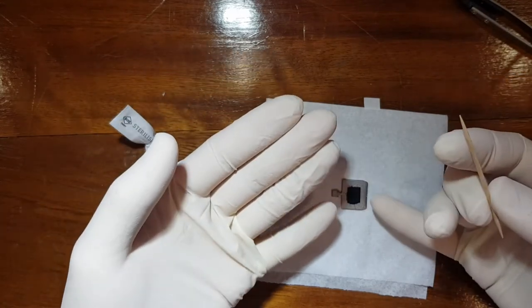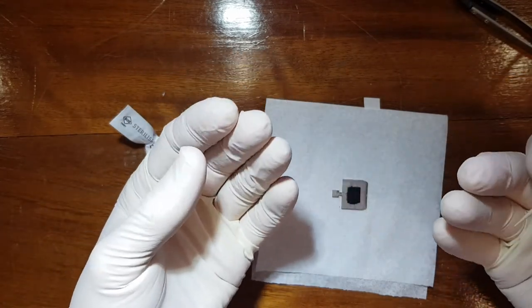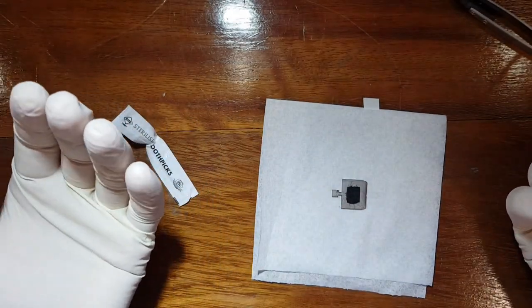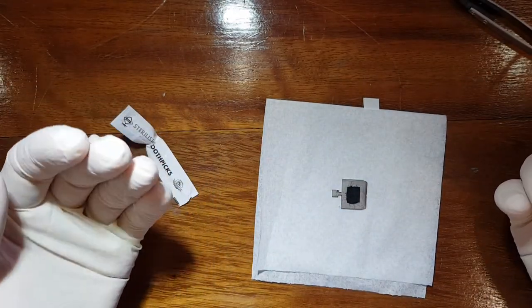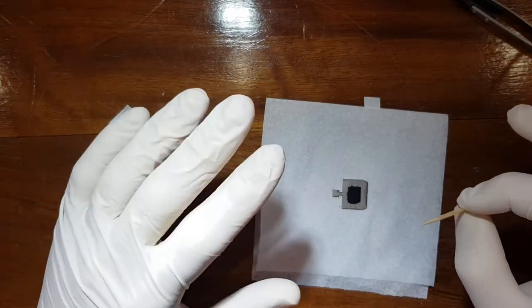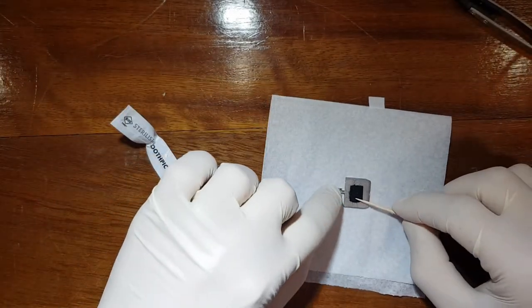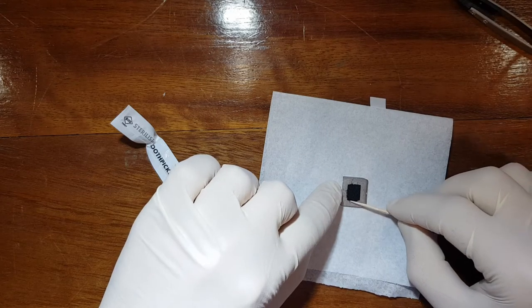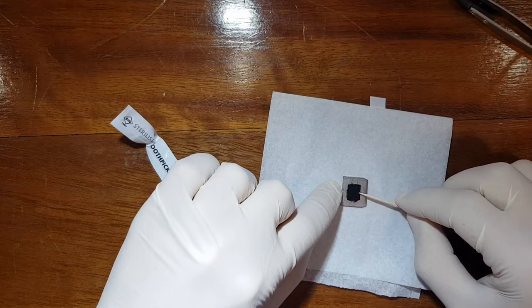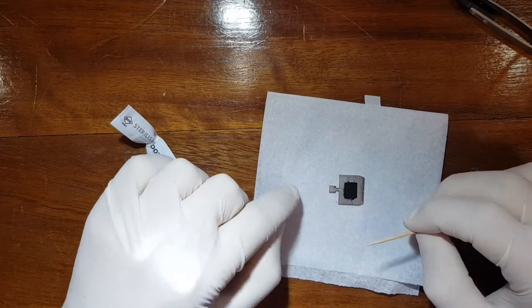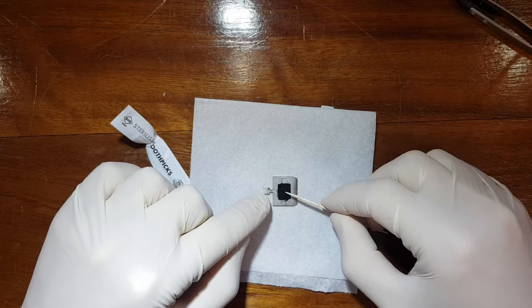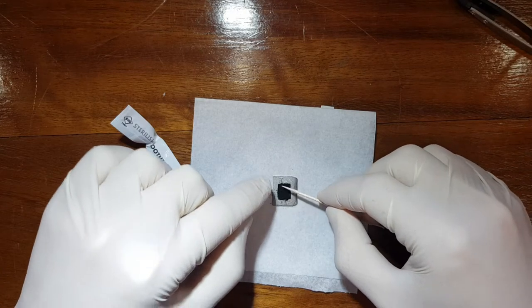That is very important. You do not want to be getting the sample onto your gloves and then handle another sample because you're going to be cross contaminating the surface. So you have to be significantly more careful than I am being at this point. But because I'm just mounting a single sample and I won't be reusing the gloves, it's not a big issue.